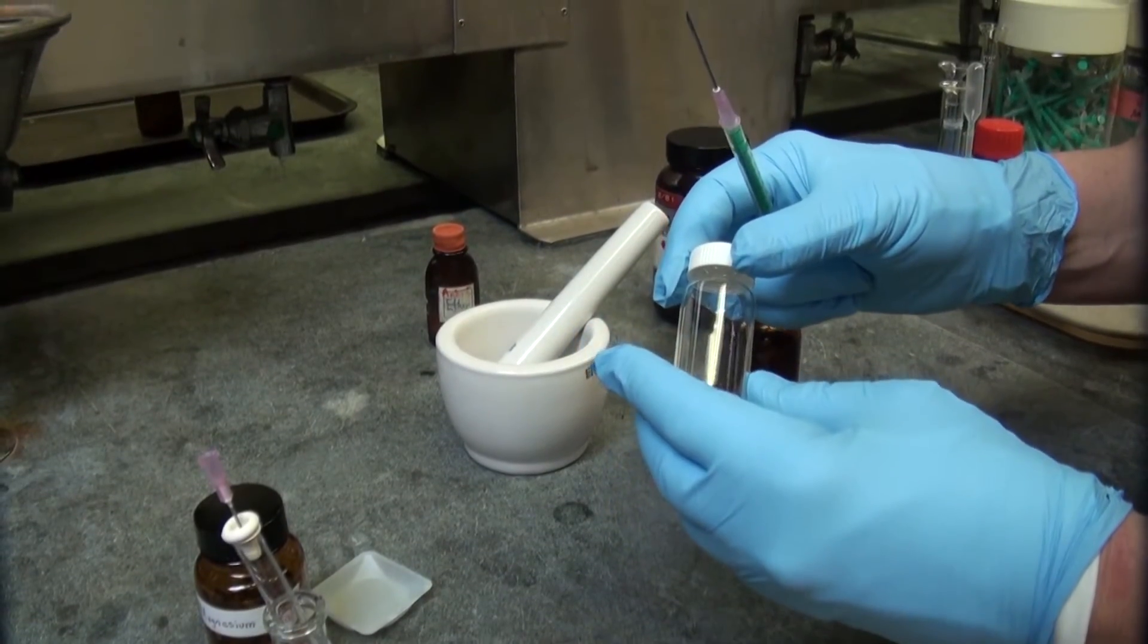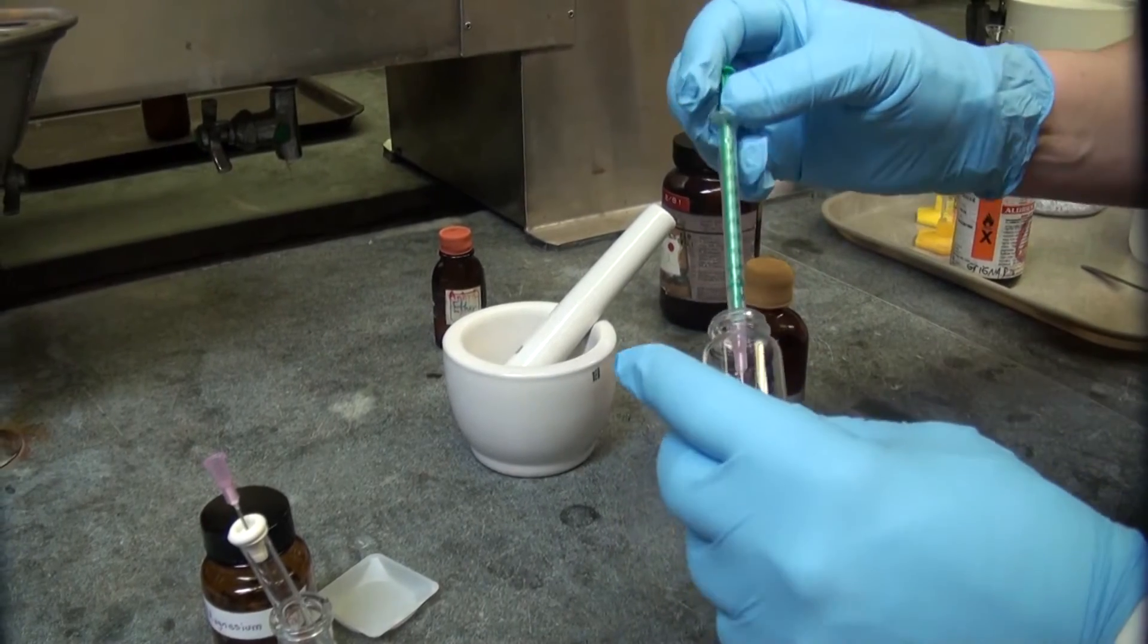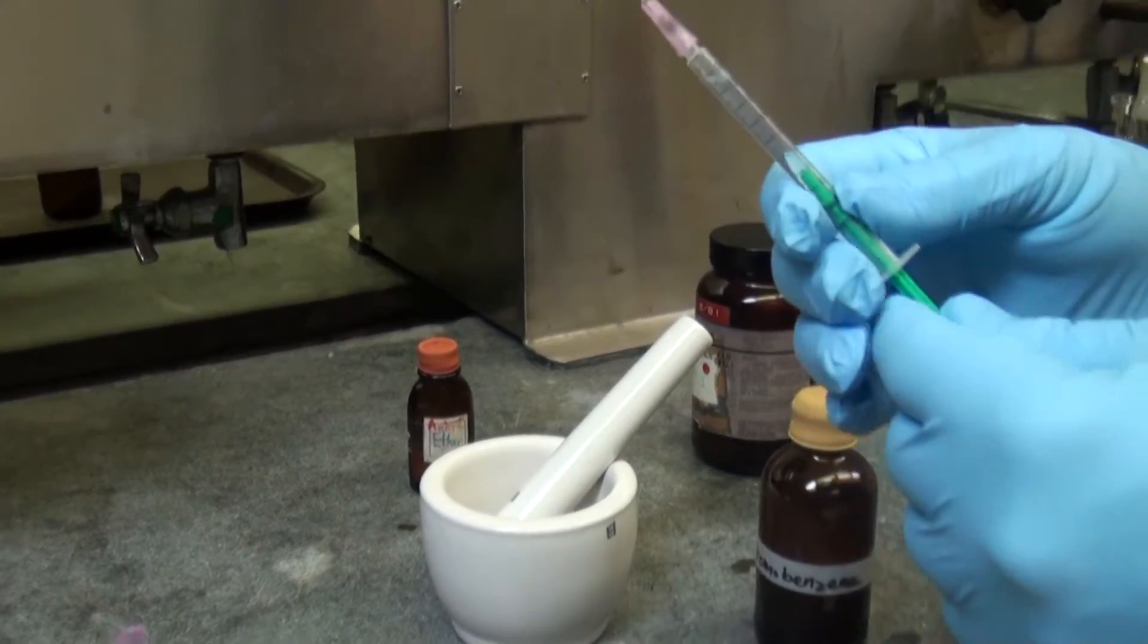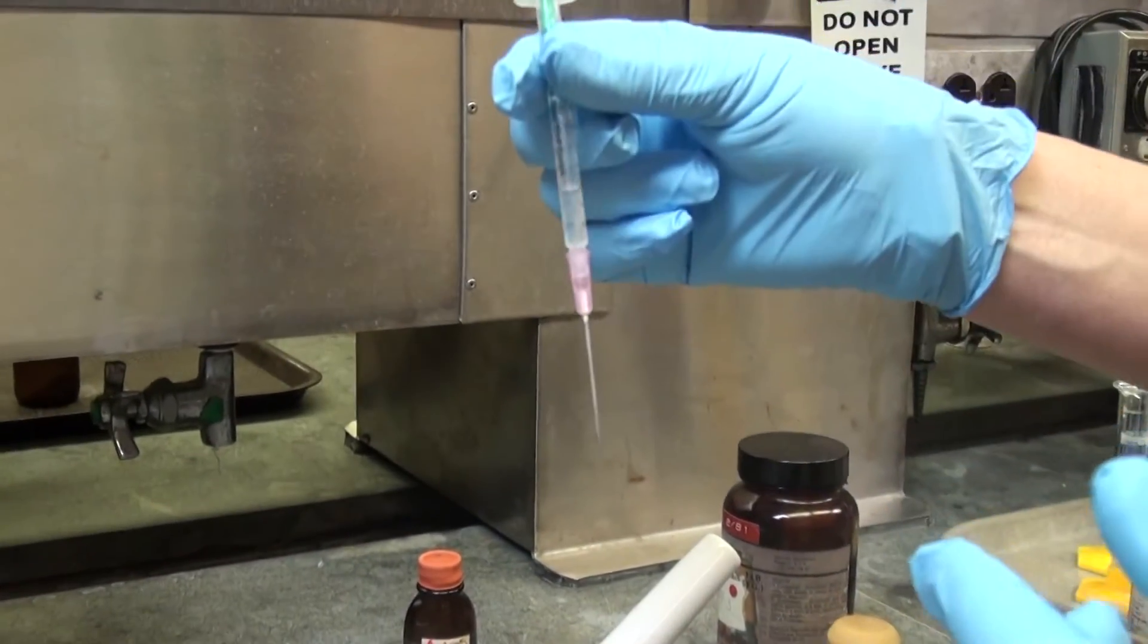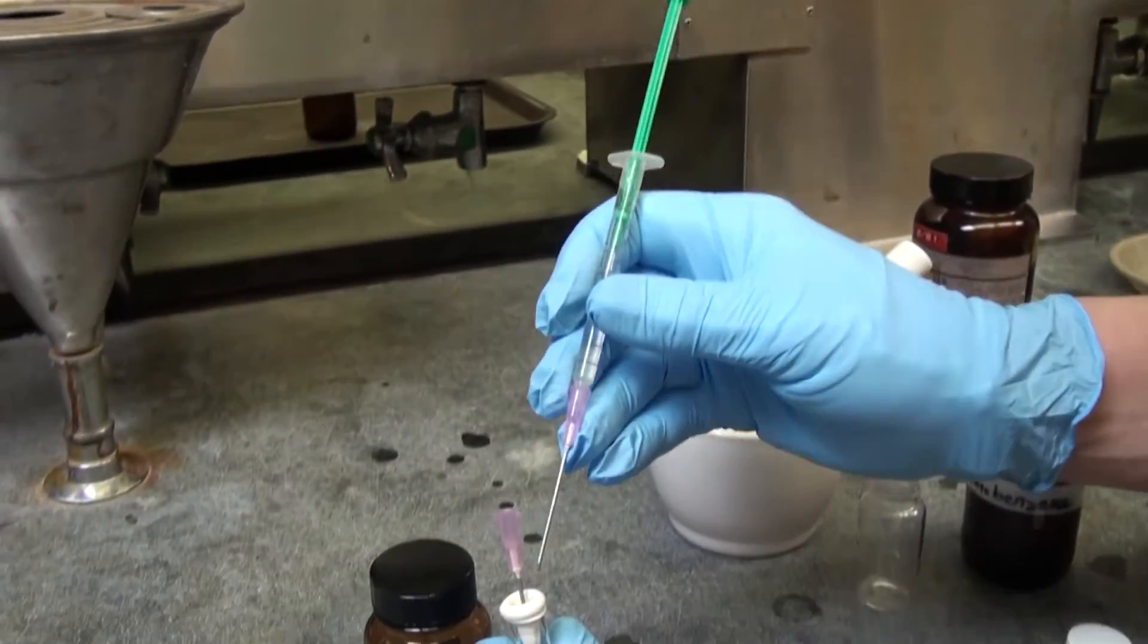Now you're taking the bromobenzene, the amount you need into a syringe and also take the ether, which is stored in the dried vial and mix both in the syringe by having a little air in here and flip the syringe. So this is now the bromobenzene solution in ether.